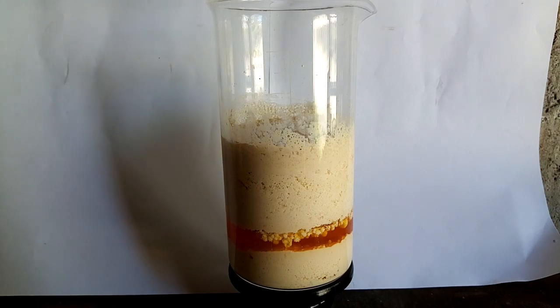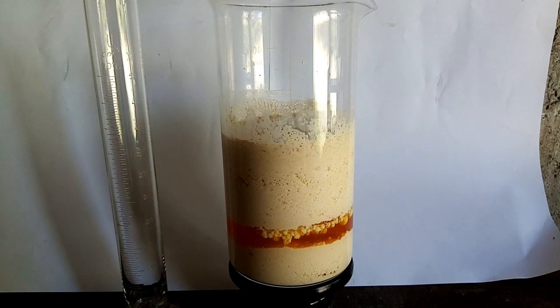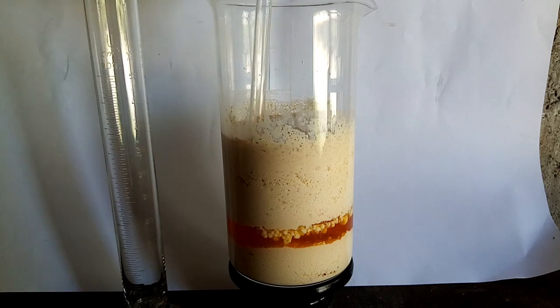For the next step I will need to extract as much acid as I can from that layer of acid, and to do that I will use just a graduated cylinder and a pipette.